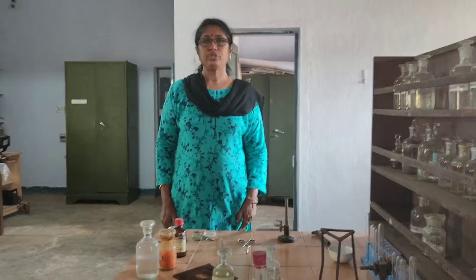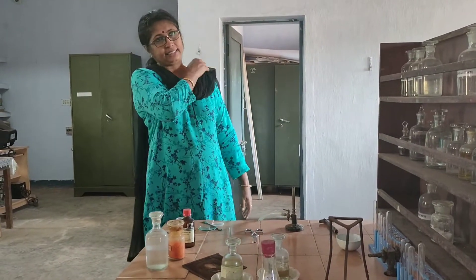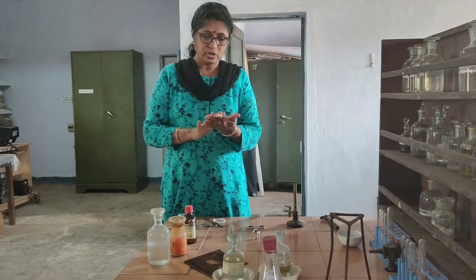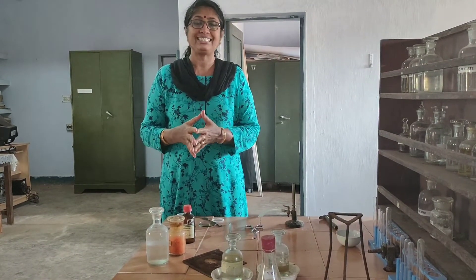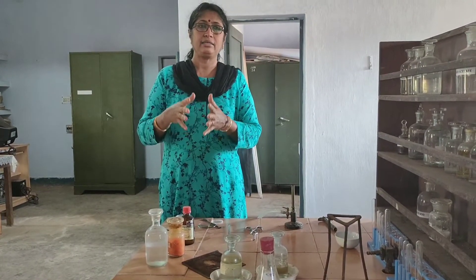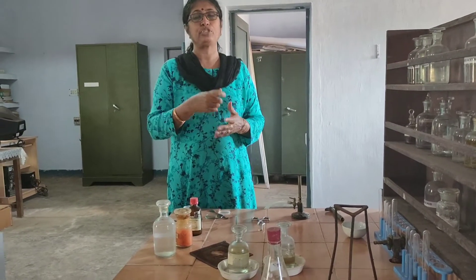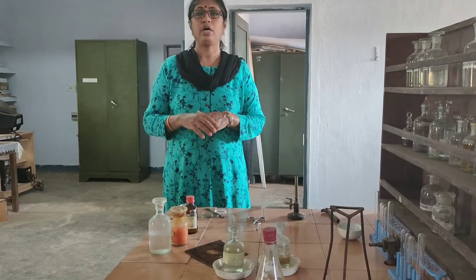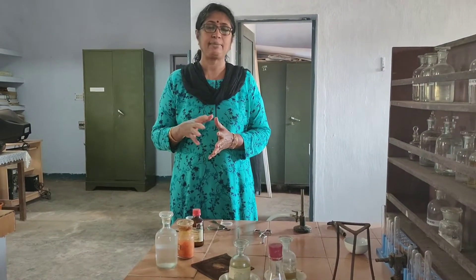We are going to start with the salt analysis. For salt analysis, you must follow the systematic method and procedure I have given. Today I will show you how to do a salt analysis systematically.